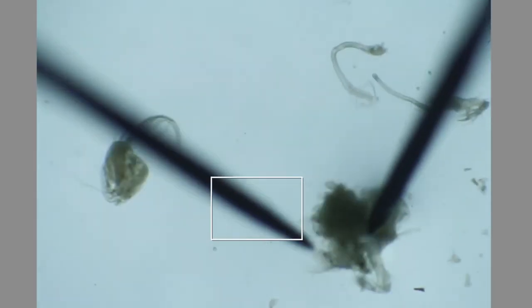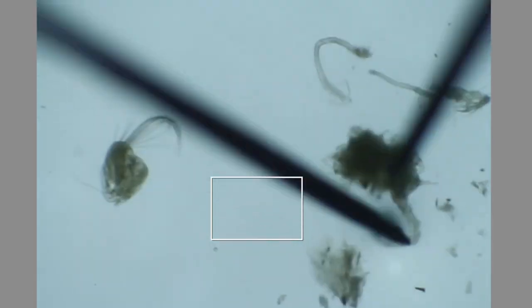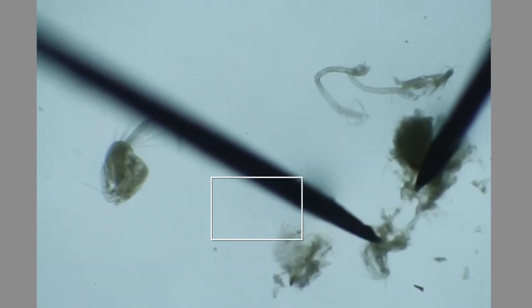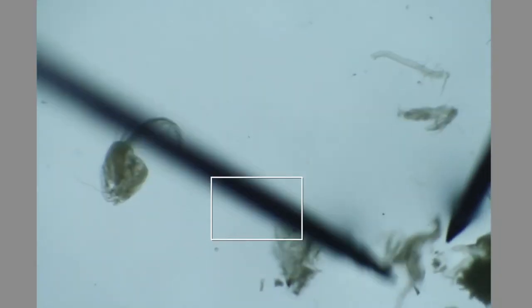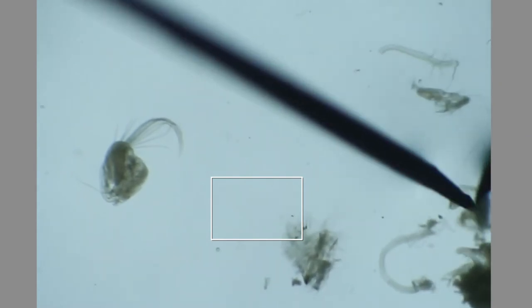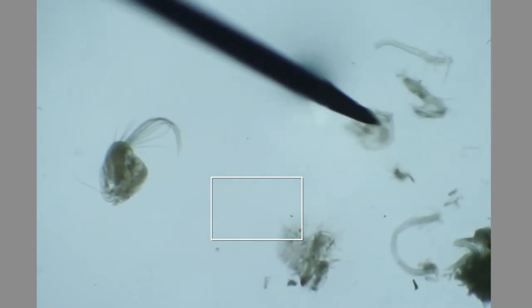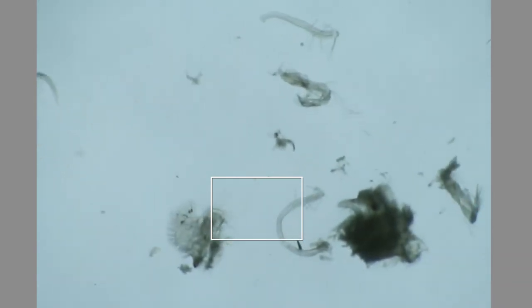Now I just need to get off the mouthpieces and all this other stuff. Notice that I'm trying to grab it as close to the body as possible so I get the full appendage. This one actually got a little extra body on it — I'm just going to cut that off. I usually have a tissue nearby so I can get anything I don't need off pretty easily.